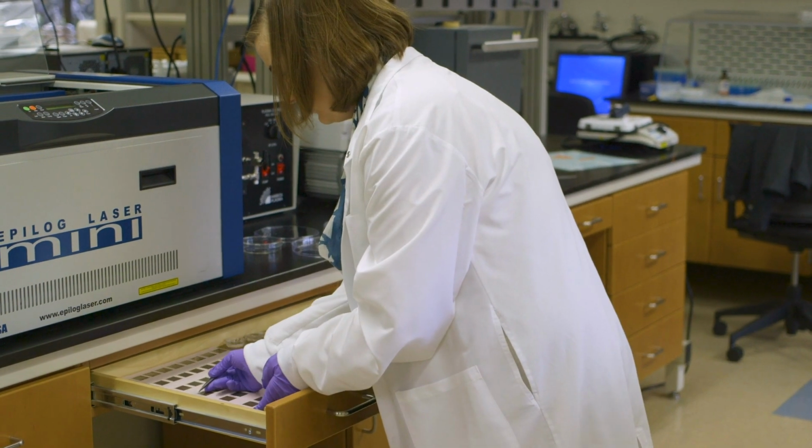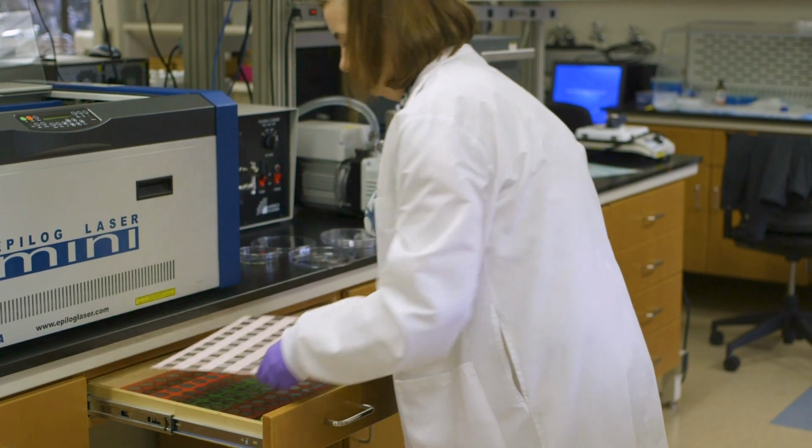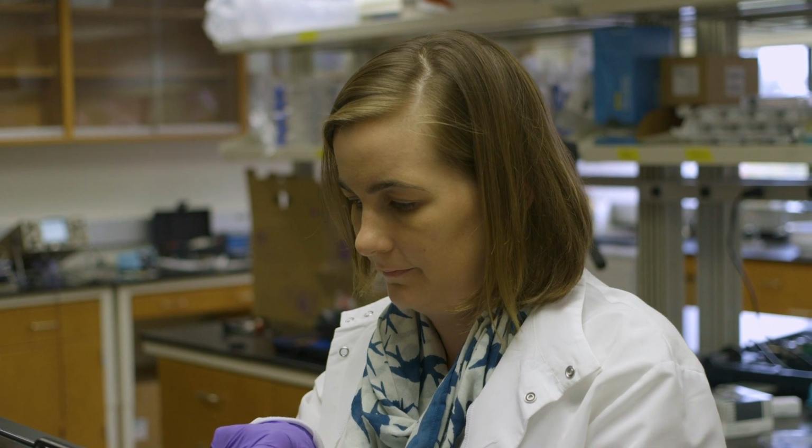The heart is very soft and flexible, right? As the heart cells contract, they can actually pump the blood, and the cells are aligned into a muscle tissue. So we want to be able to capture those features of the environment that the cells experience in the body in the dish. And so we use a lot of different biomaterials and tissue engineering techniques to be able to model certain physical features of the human body within the lab.